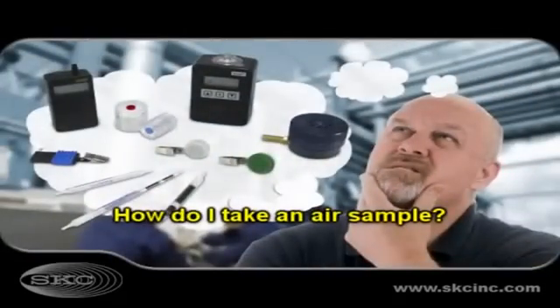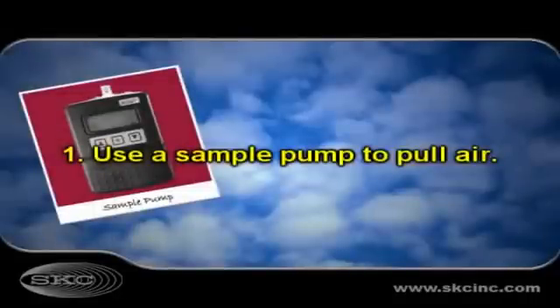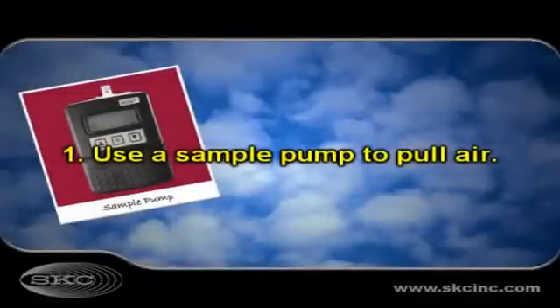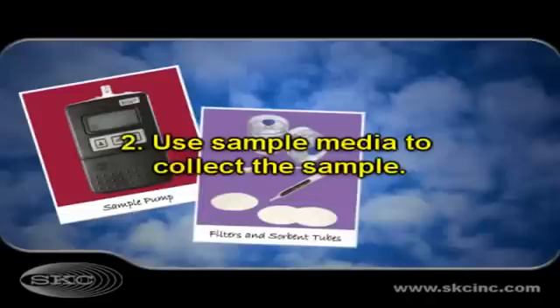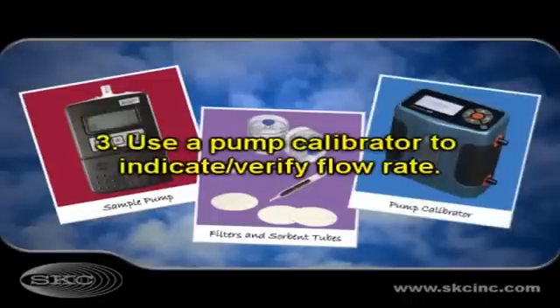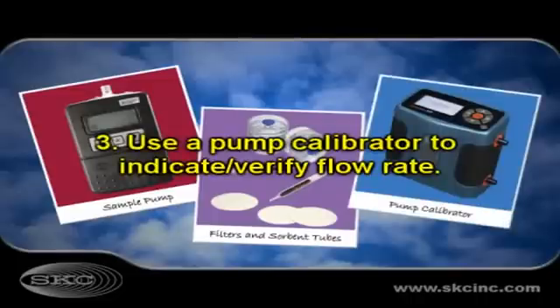How do I take an air sample? Active air sampling involves three things: 1. A sample pump to pull air. 2. Sample media through which to pull the air. And 3. A pump calibrator to indicate and verify how much air is pulled.